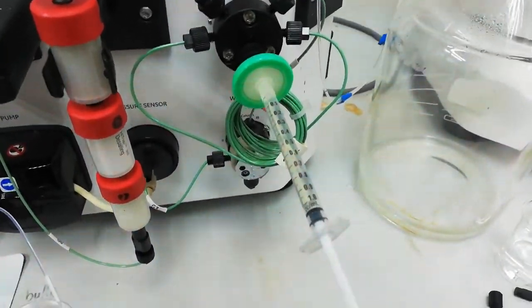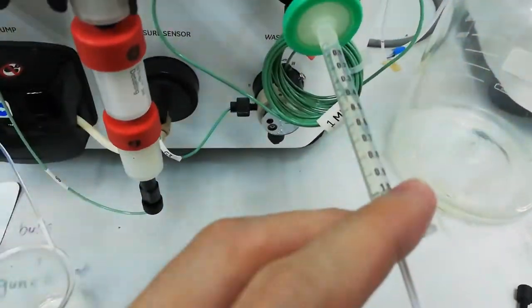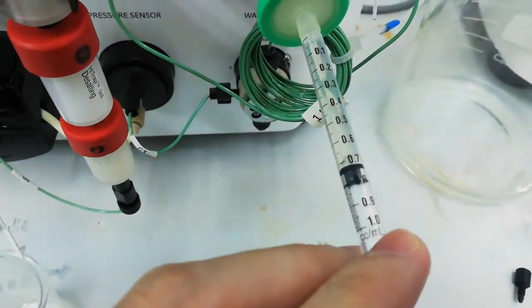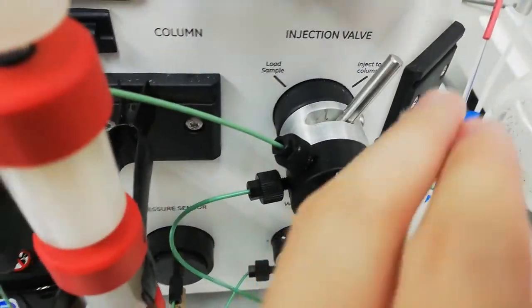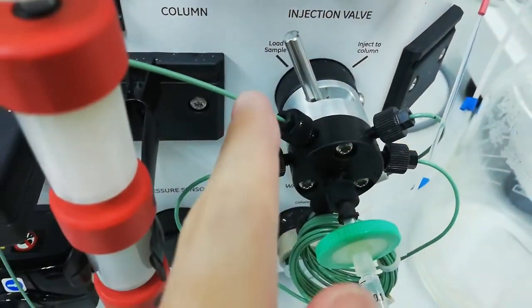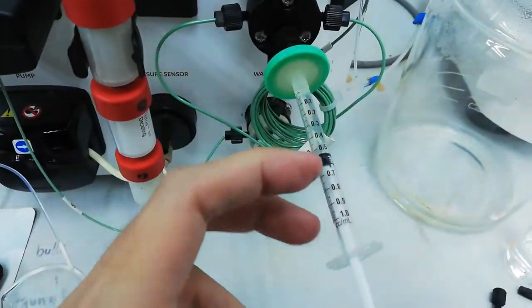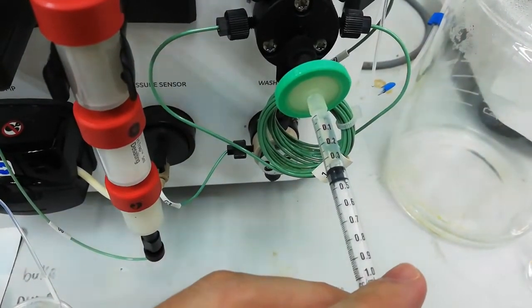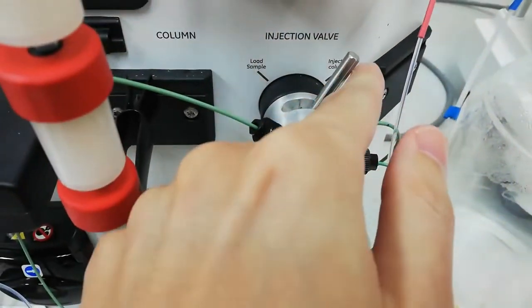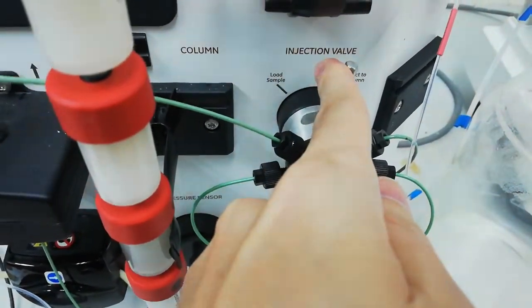My suggestion is to separate the injection into a few steps. First, try to inject a little bit until you feel the pressure, then load the sample. The sample will be loading into the loop before running. Switch again to inject to the column and keep injecting a little bit at a time. Then load the sample again. You can keep repeating this for a few times until you have completely injected your sample.